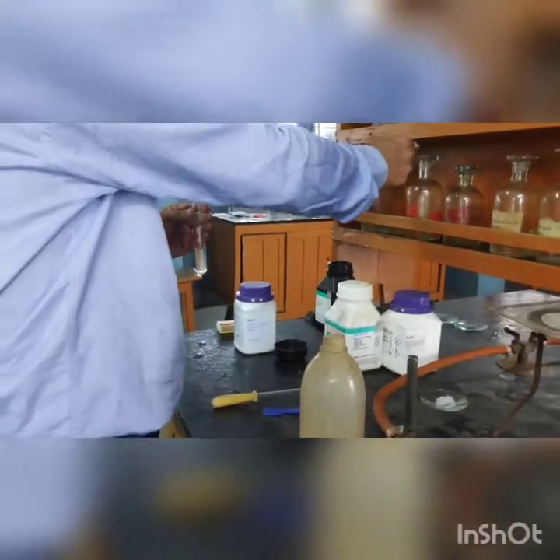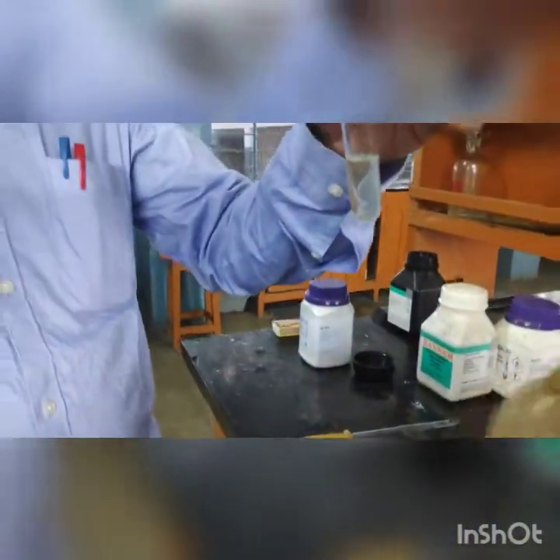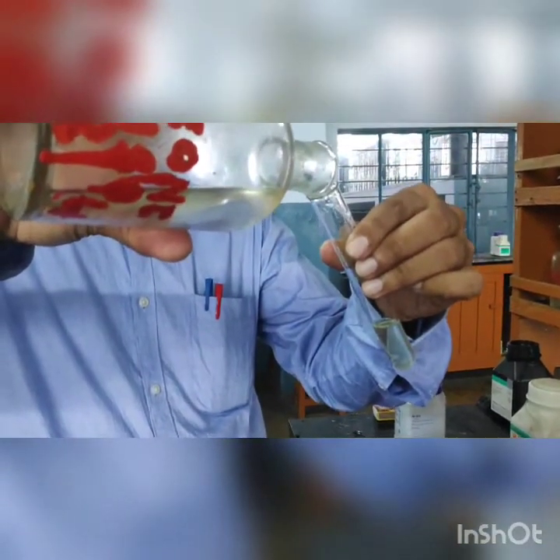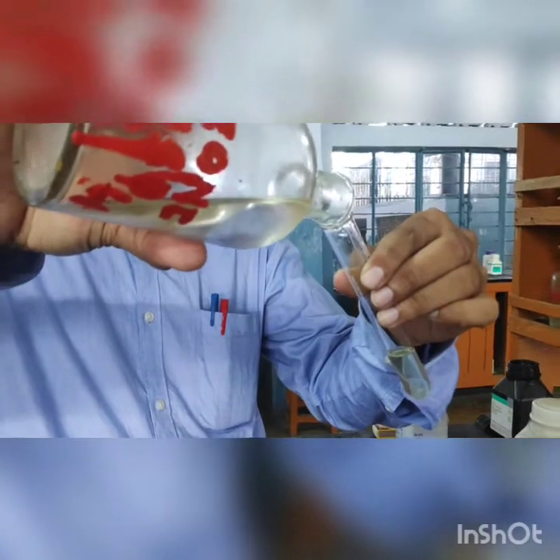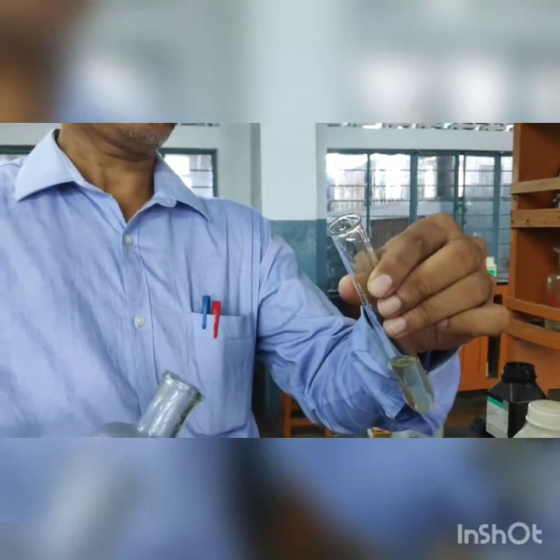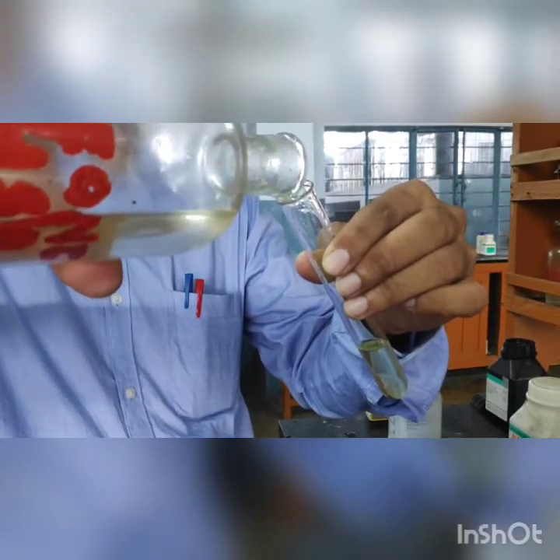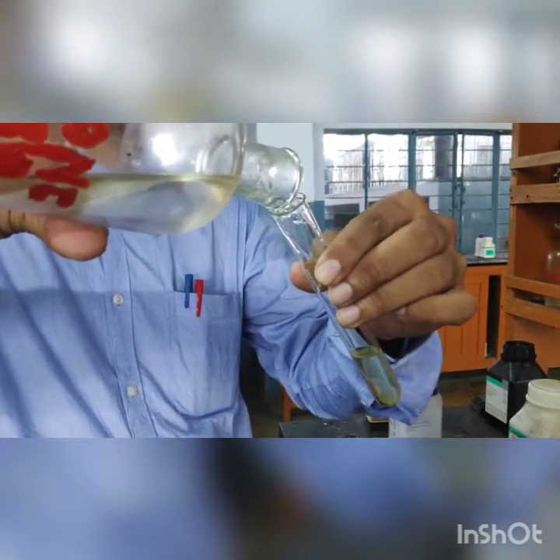The test is to add freshly prepared ferrous sulfate solution in almost equal amount to the sodium carbonate filtrate. Then, in a slanting position, concentrated sulfuric acid will be added carefully so we can see a brown ring forming at the junction of the two liquids. Since sulfuric acid is heavy, it will settle at the bottom.